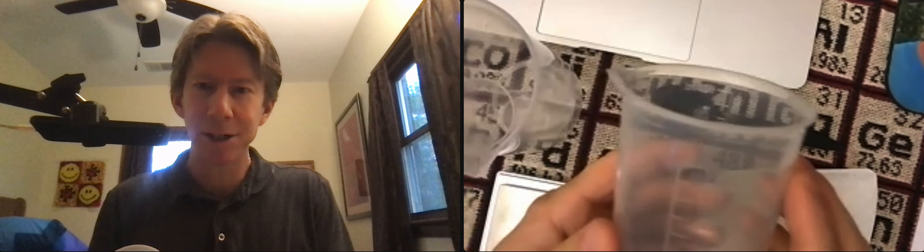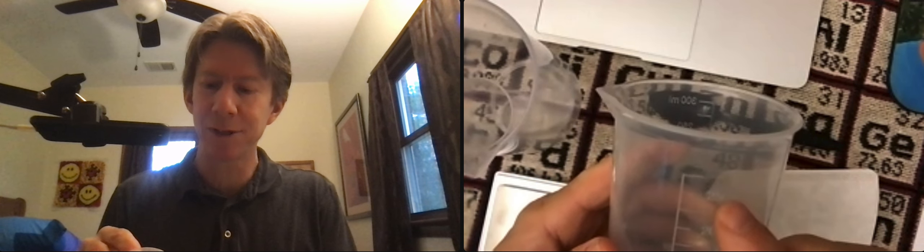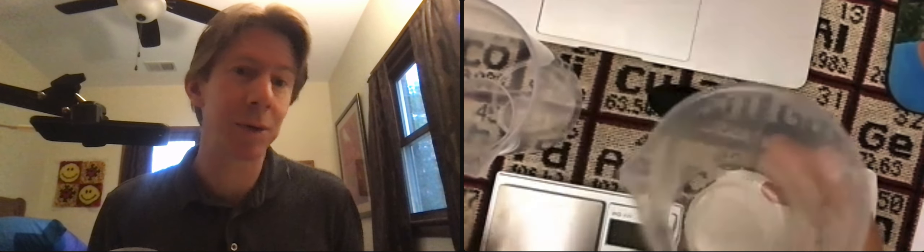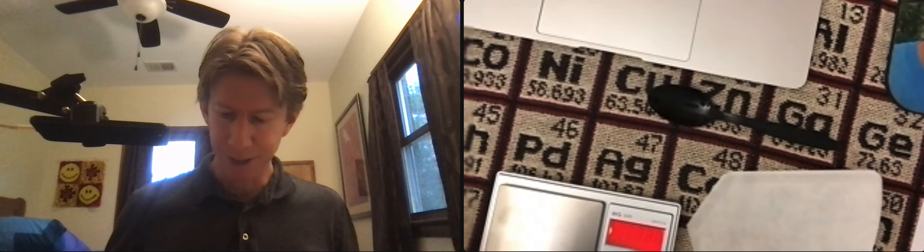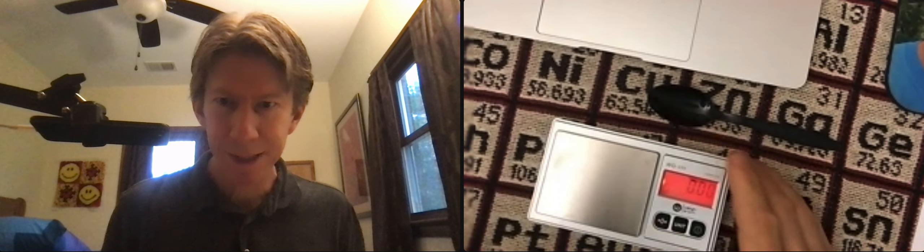You can see here mine has markings to 250 but it probably holds 300 milliliters or so. Turn on my scale and everything else to the side here. Good, I've got the little dot there.